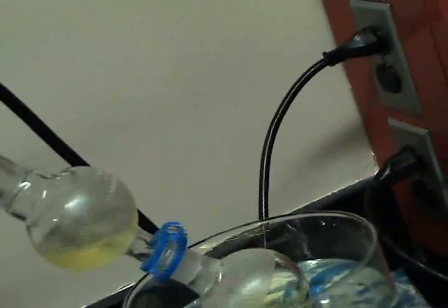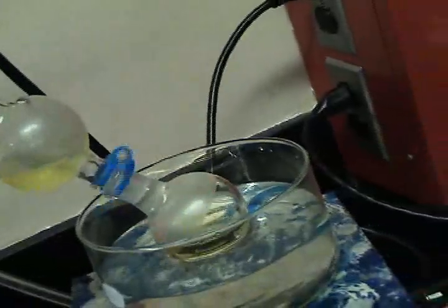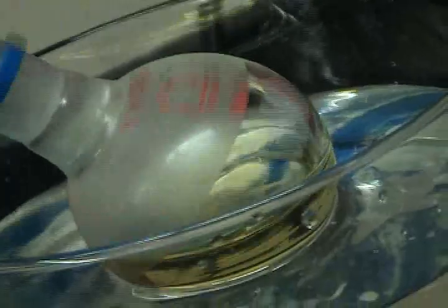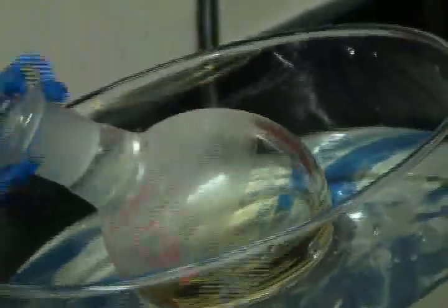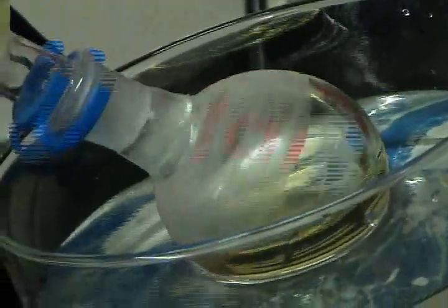You'll recall what I was saying about the temperature before. On the flask here, that is not in the water, or we look at the flask in the water, we see where there is water touching the flask, it is clear. But on top, we have a layer of ice that has formed from condensation on the flask, being frozen because of the evaporation process.